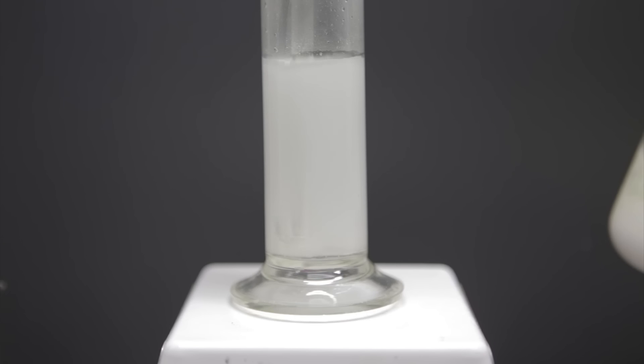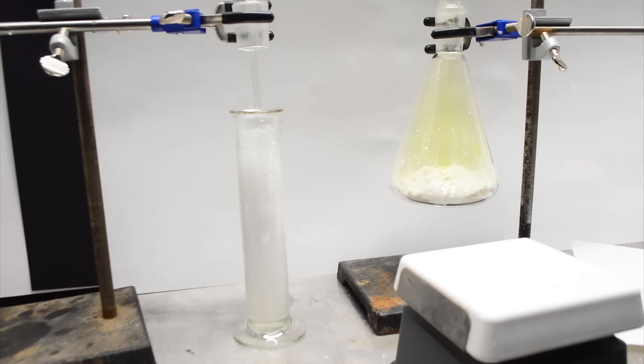That's not to say that every run was this good. We had several duds because we weren't really being overly precise with our measurements, and were mostly just eyeballing everything. One thing we quickly found was that you do need a fair bit of base for this to work, but that also tends to really angry up the solution. I estimate it was about a 20% hydroxide concentration that works well, so we eventually figured out a recipe that worked, even though we were just eyeballing things to measure things out.